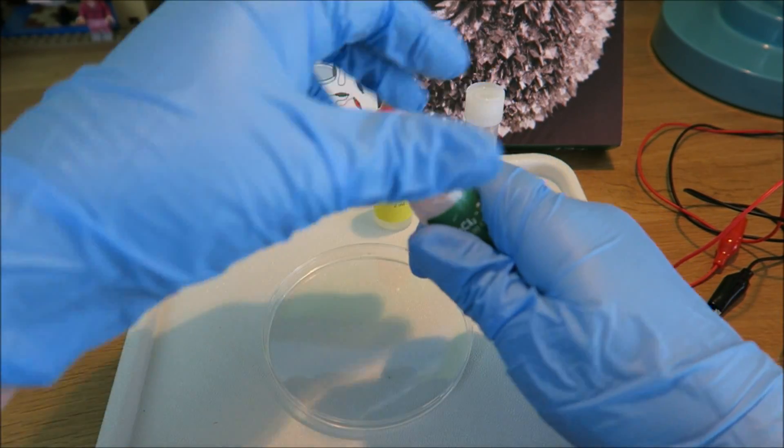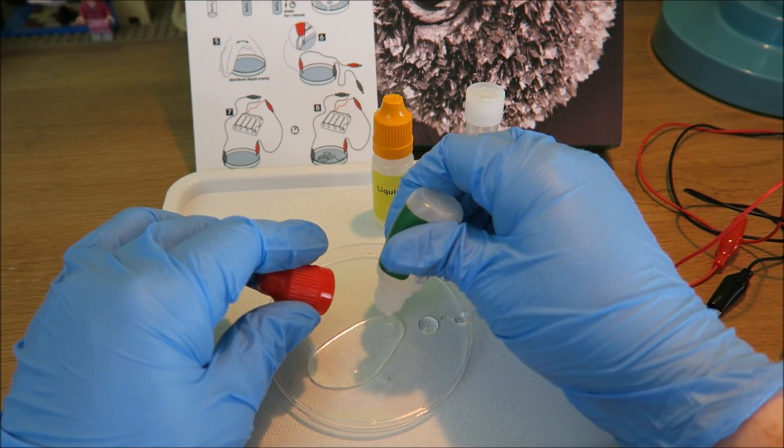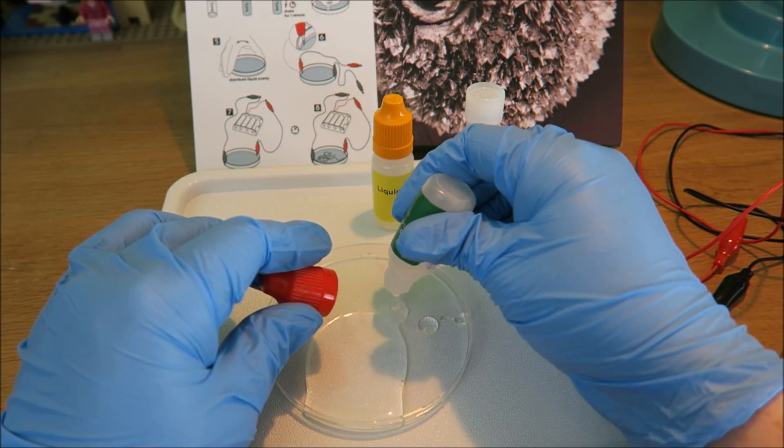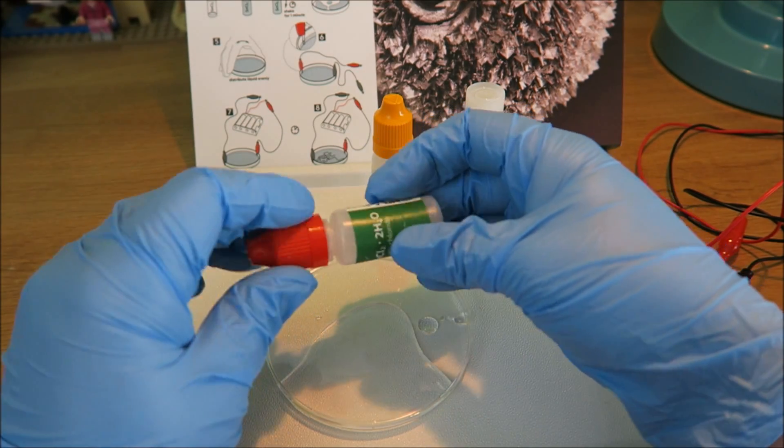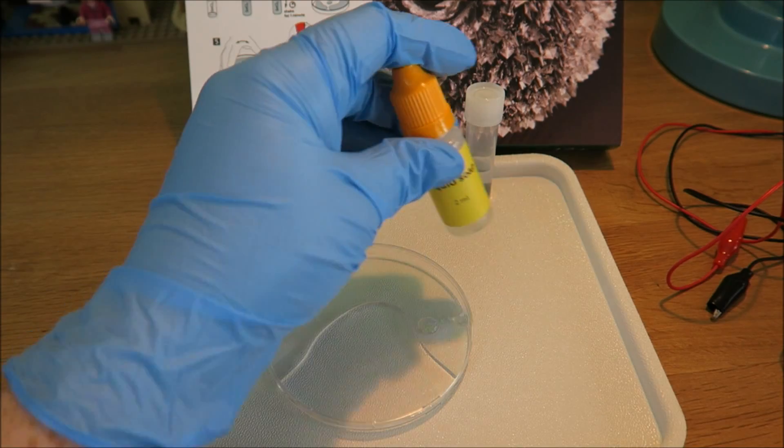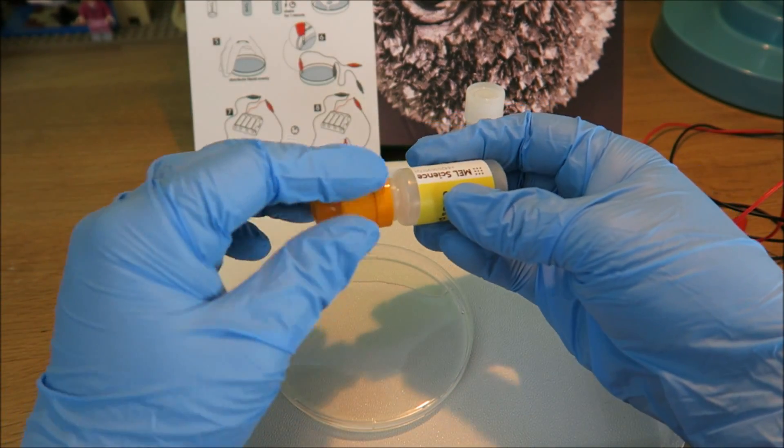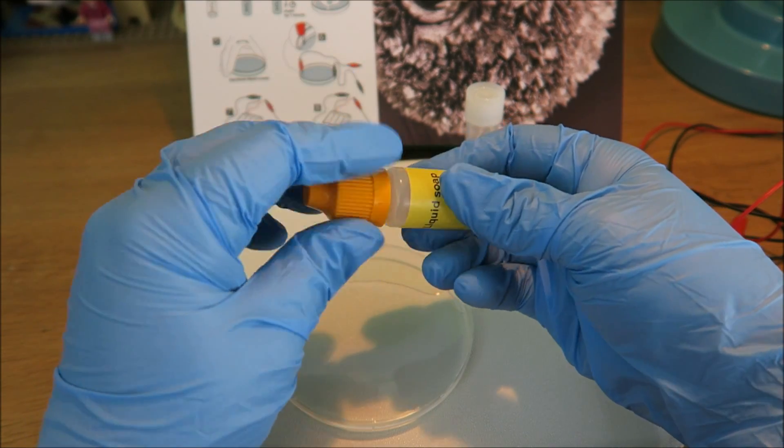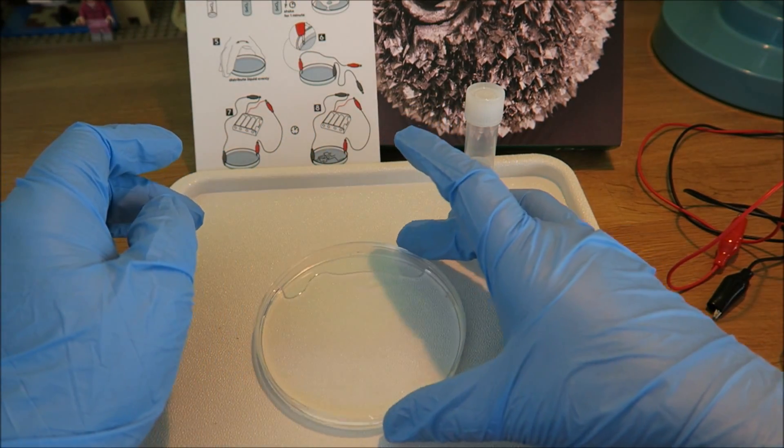Now all of this goes in here. We have two drops of soap. Swirl it around a little bit.